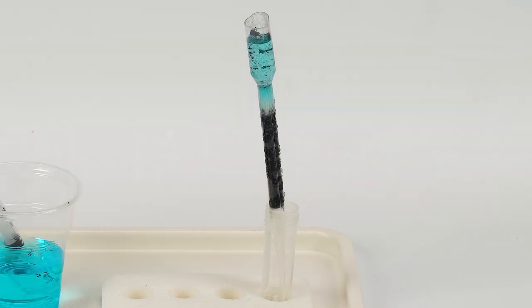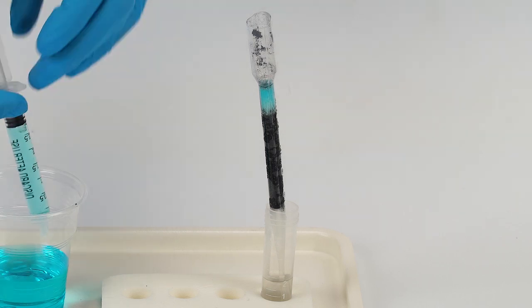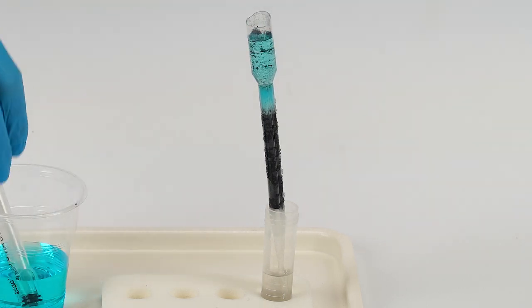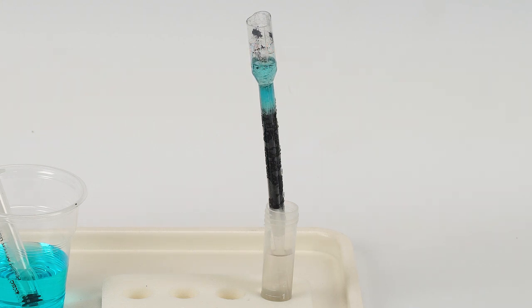Wait a bit to let the water pass through the filter. The water in the vial is free of methylene blue. The organic contaminant particles readily stick to the surface of the activated carbon. Since activated carbon is riddled with cracks and holes, it has a huge surface area. While most of the pollutant molecules stick to this surface, water molecules pass through easily.